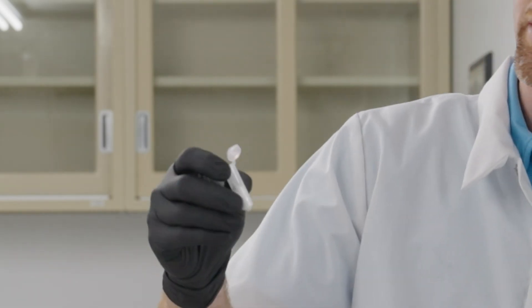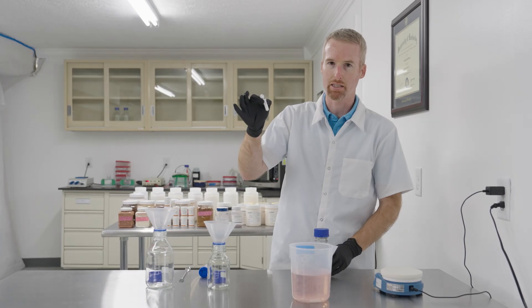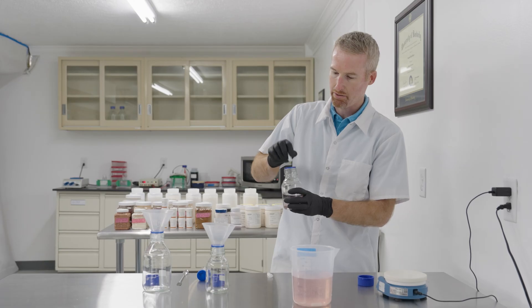I have here a typical enzyme. This is a lyophilized galactosidase enzyme, and I'm going to add it to a solution of lactose.